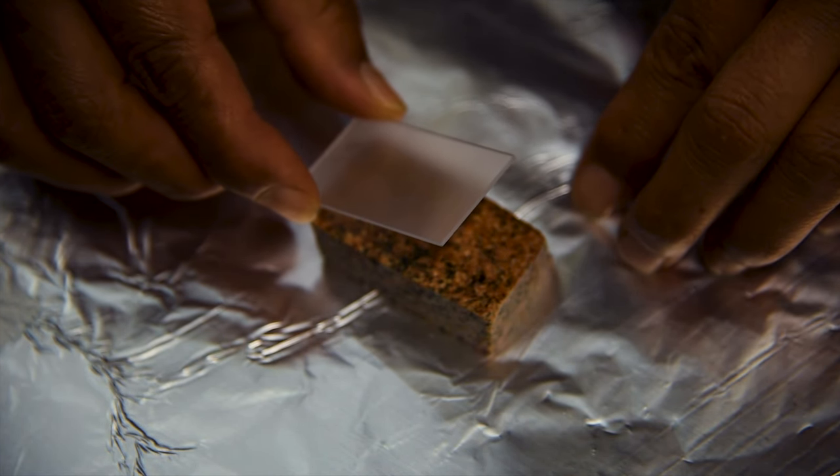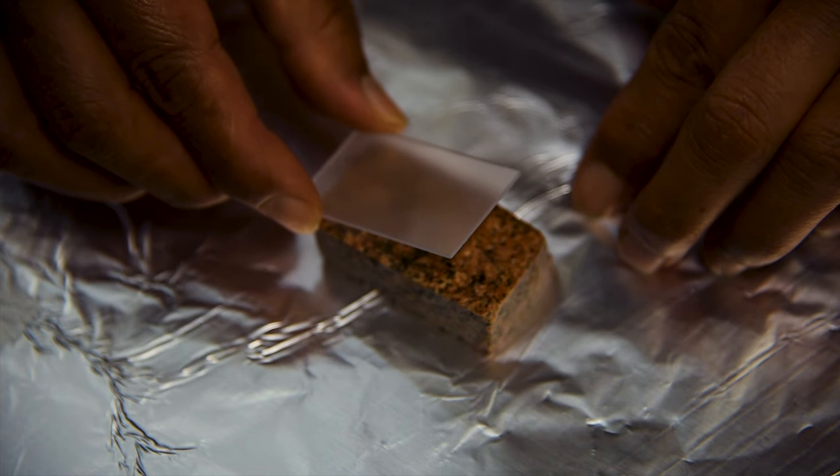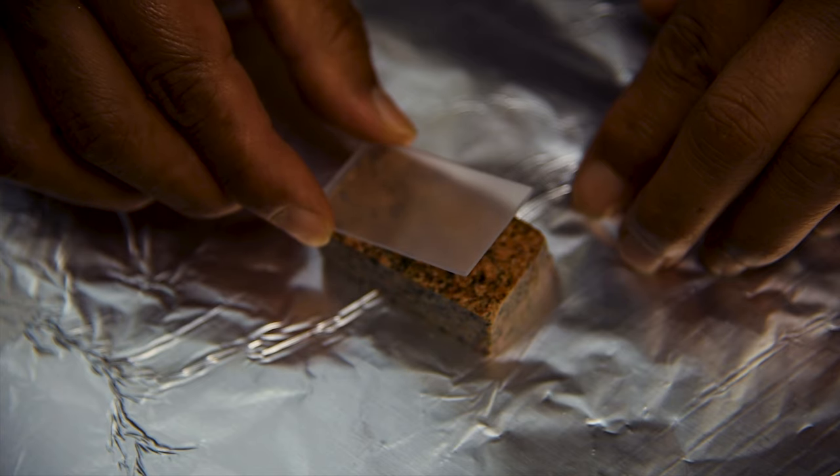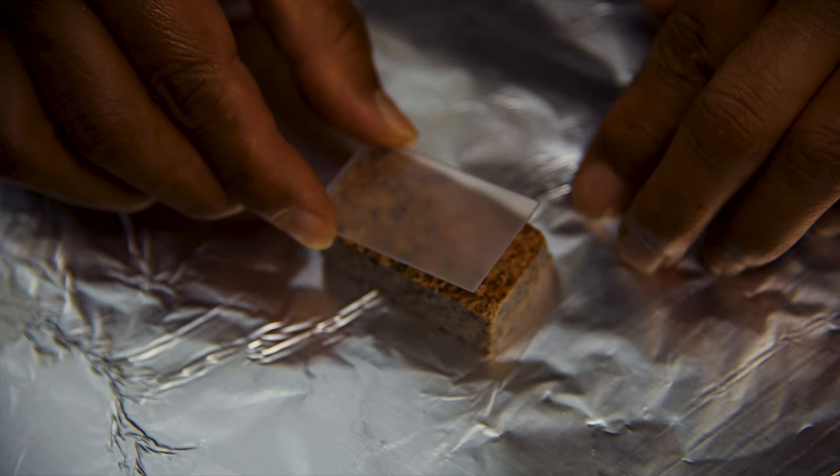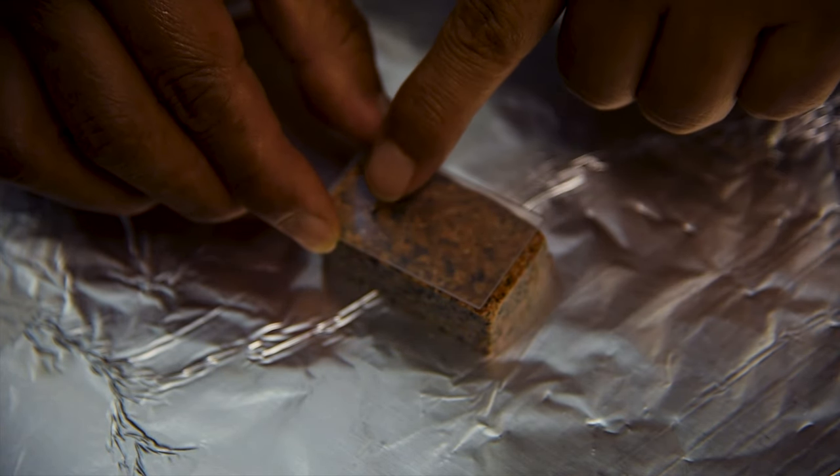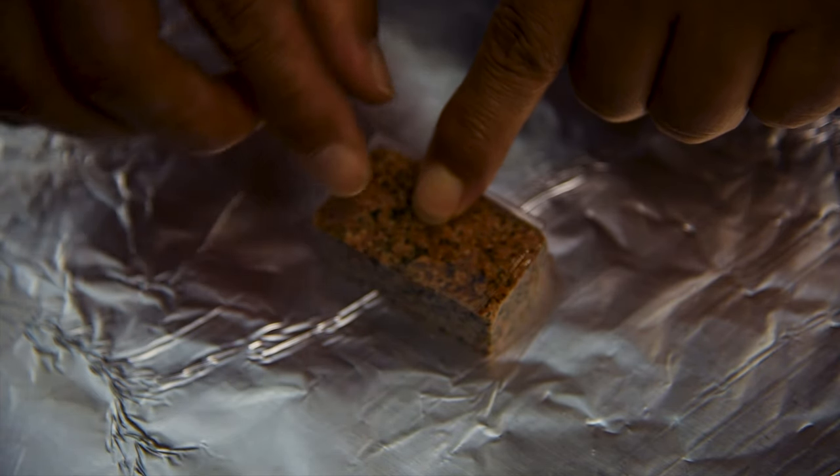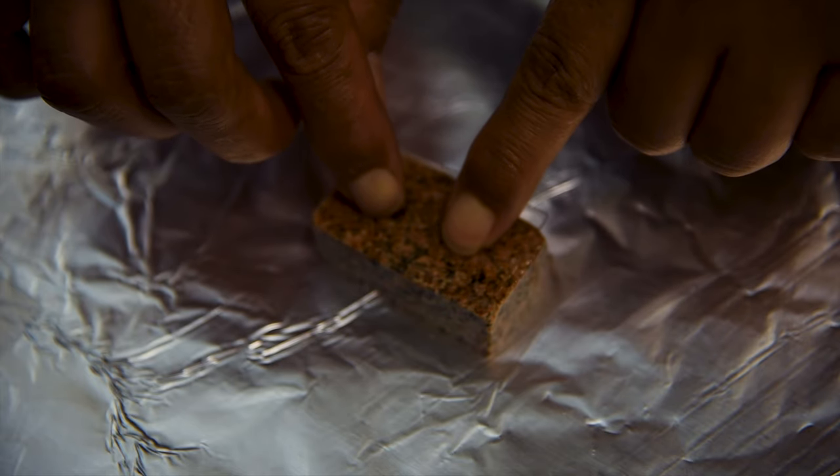Before placing the glass slide onto the epoxy-coated sample chip, make sure that you have the frosted side down and the unfrosted side up before applying it to the chip. When ready, place the slide frosted side down on one side of the chip and carefully let it fall across the surface to the other side to avoid trapping any large bubbles.